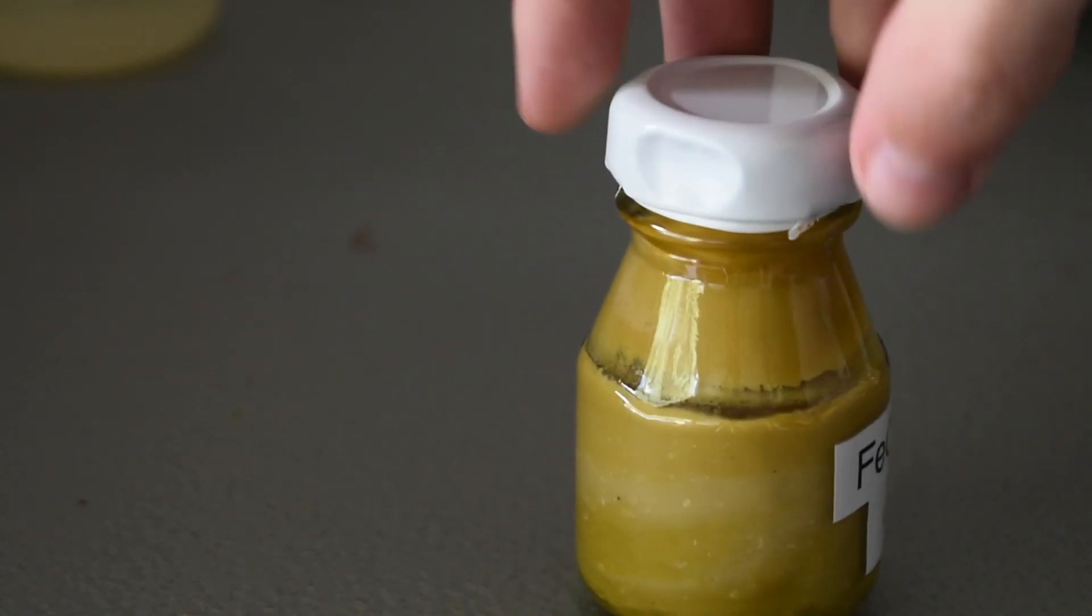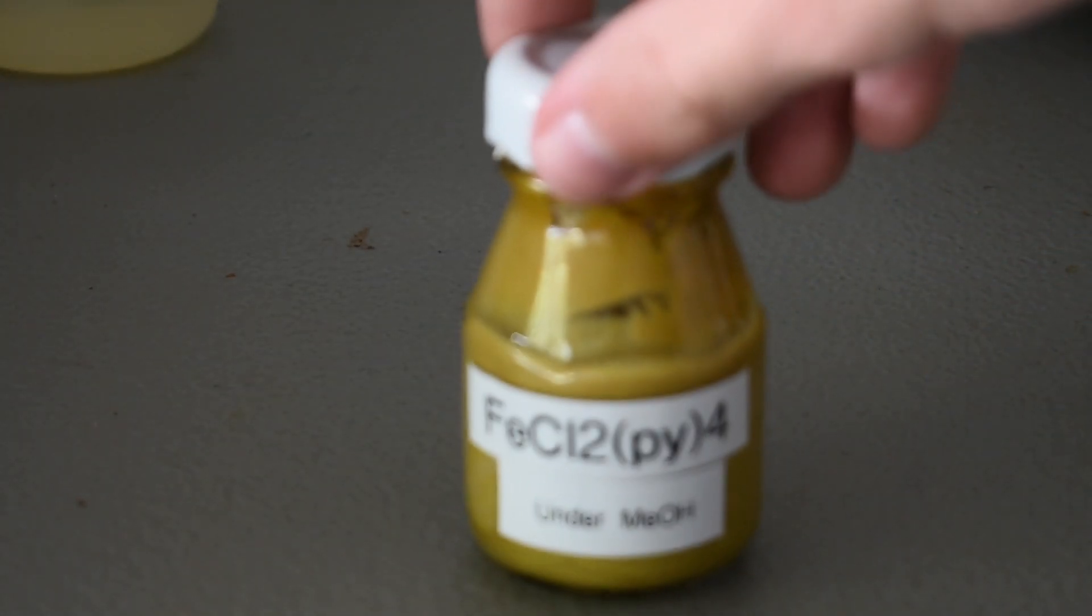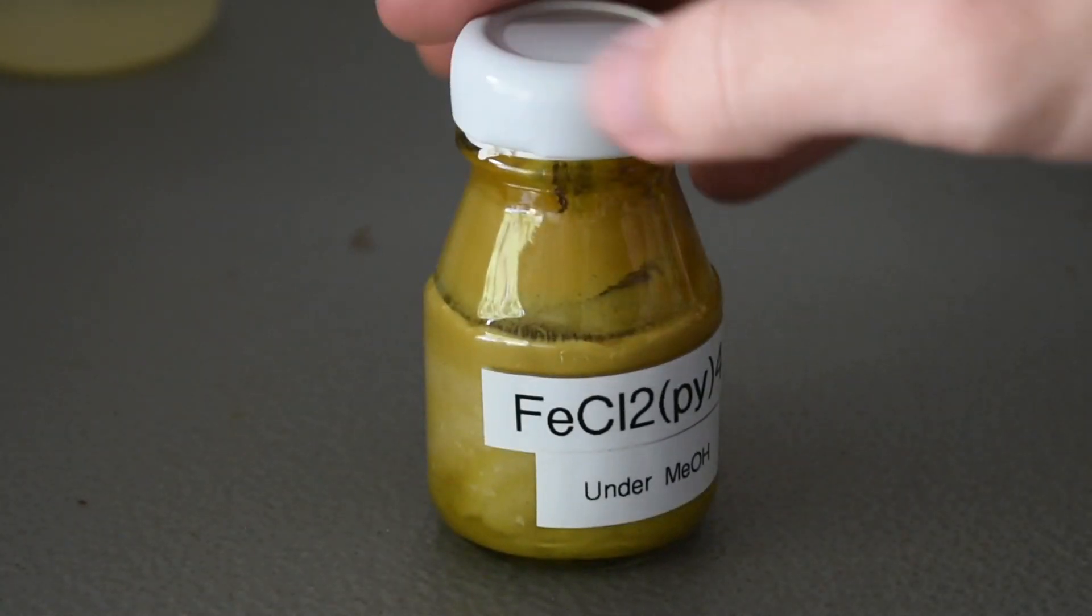But I'm happy with the amount that I got. It's not as vibrant yellow as it was before. It's kind of getting a more pukey brown, yellowy kind of color. But it's still pretty cool. Still a pretty cool color.